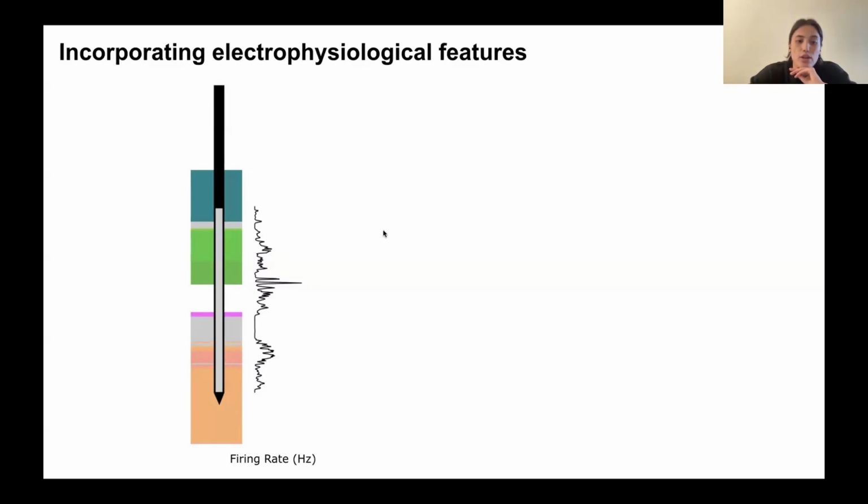This diagram here shows the concept behind this. On the left-hand side, we have our Neuropixel probe and the brain regions that it passes through. On the right-hand side, we show the firing rate that we've recorded across the session on this probe. You can see that we have this area here that has a very low firing rate. Based on our prior knowledge, we expect that this should come from a region that has very few or no neurons.